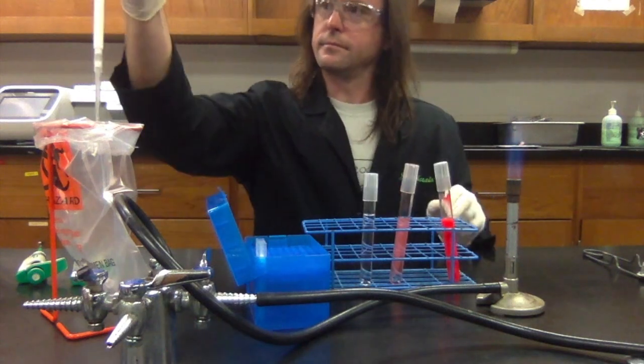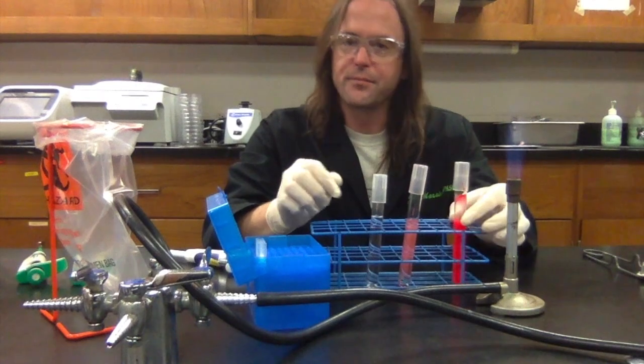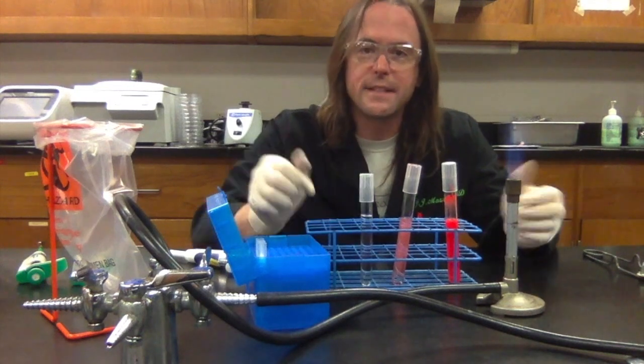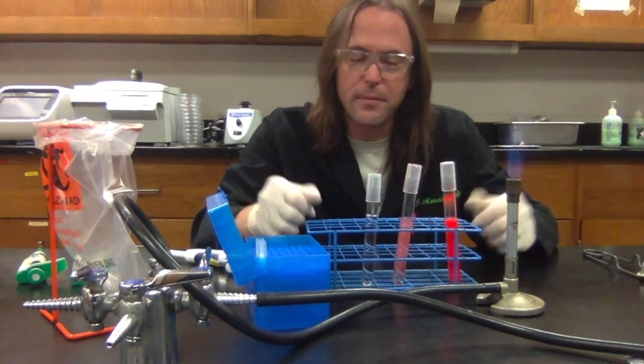All right. So now you can see that I have a dilution series, right? So this one is the most concentrated, and this one is the most dilute. So you're going to be doing this with bacterial cultures a lot in this class. It's a very important technique.